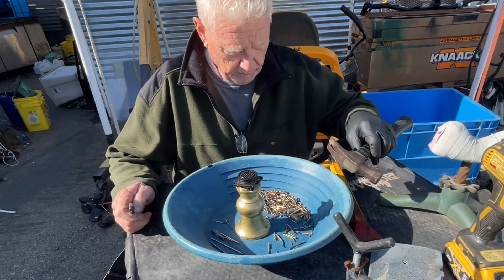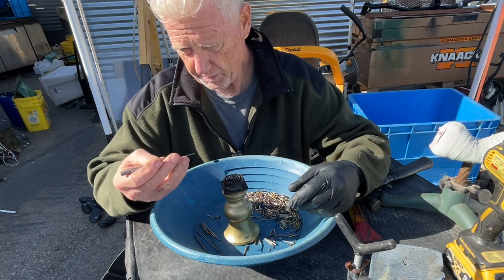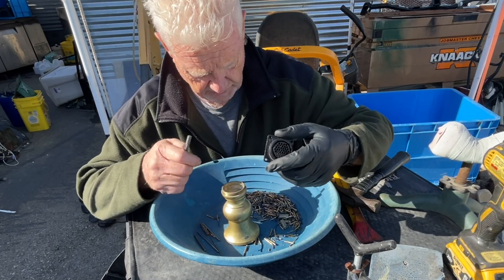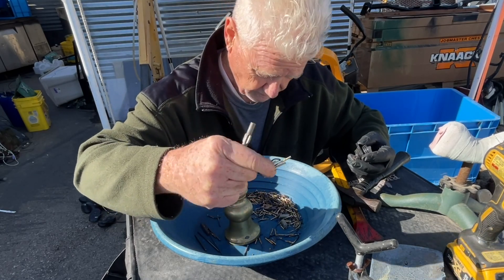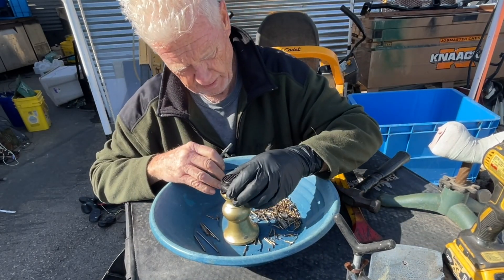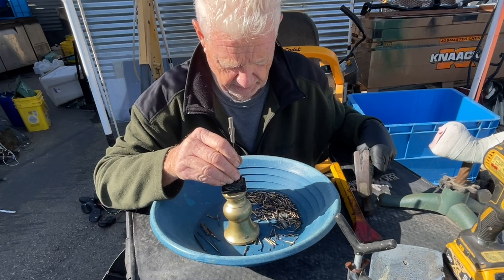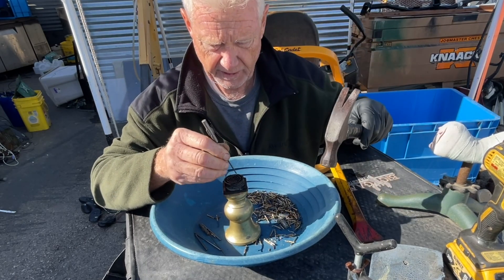Removing these pins with a little punch — this is a hex key driver. These pins have a little stainless on the edge, so I need to test them. I'm thinking I can use dilute nitric on these guys, and it won't attack the stainless. Put these dudes in and just a little tap to get them out.